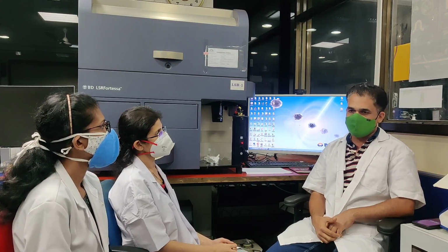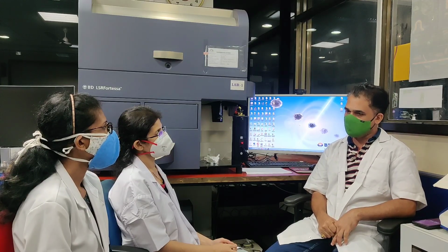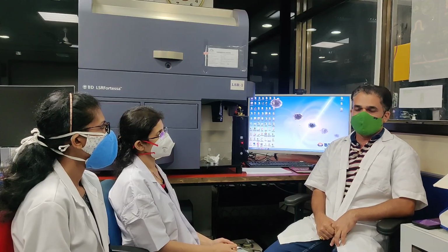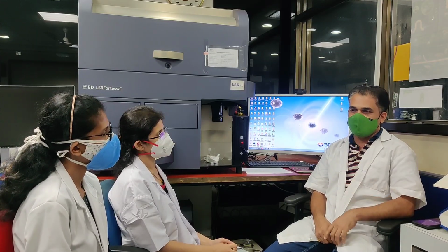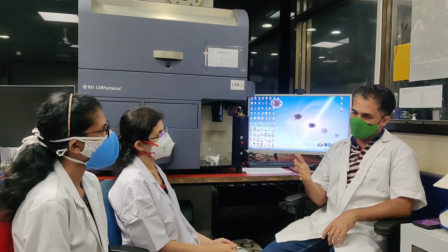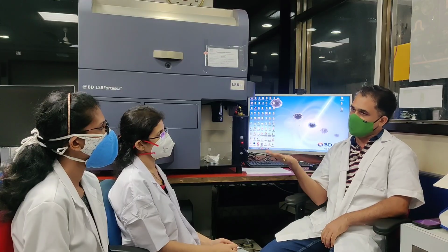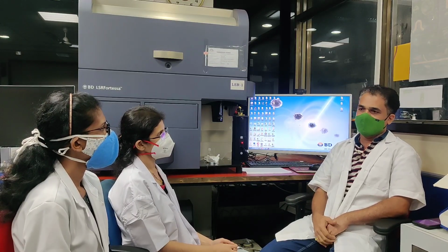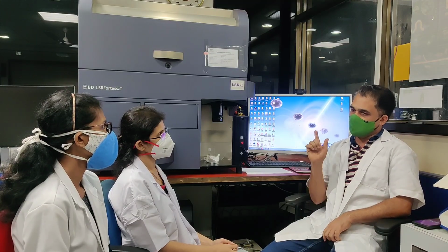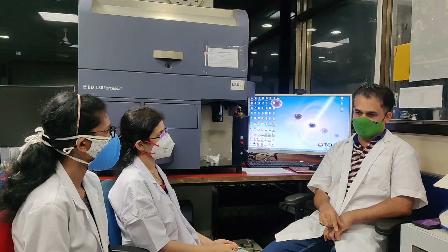After the excellent talk by Badri sir, we have learned so much about CD34, that is stem cell enumeration, and processing, from our colleague. So we will do the acquisition now. In acquisition we are going to tell how to acquire the stem cell enumeration sample, as well as how to do the control, and post that we will do the analysis on Kaluza. In our lab we are using the stem kit from Beckman Coulter, as well as the stem cell enumeration kit from BD.